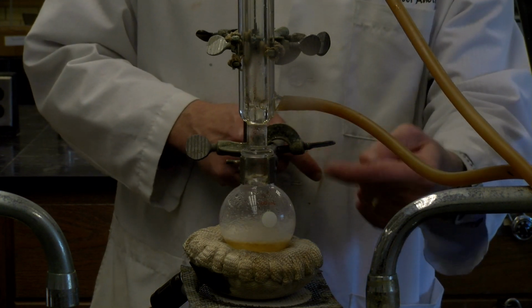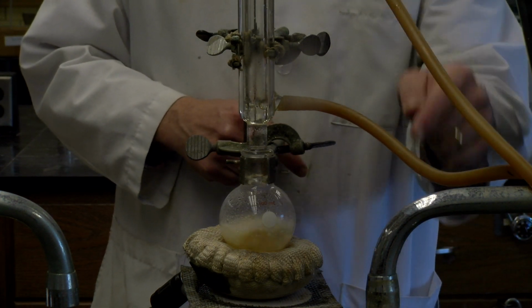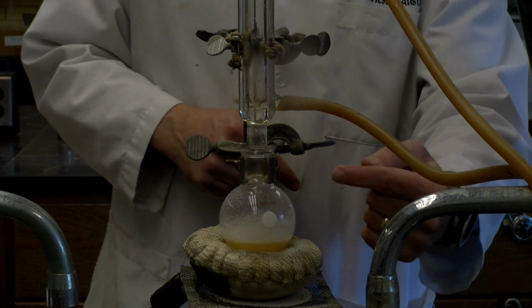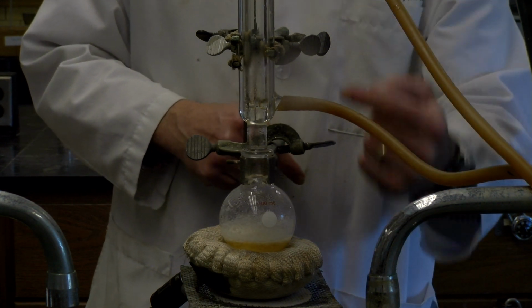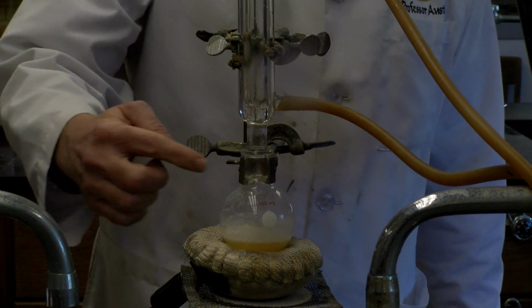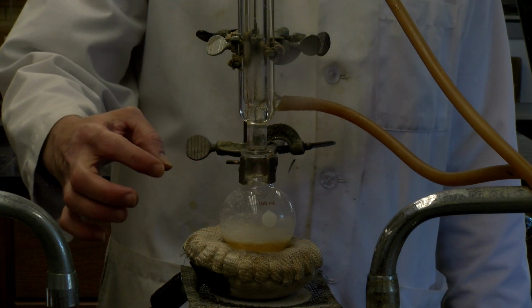So the reflux is really heating the solvent up, with these water tubes with our water flowing through there, coming up, cools it down and then allows the solvent to return. All right, so this basically allows us to heat the solution fairly high without heating away the solvent. So we're able to sort of have this continual mix of allowing this to occur. All right, so what that permits us to do then is to heat up the reactants to fairly high temperature.